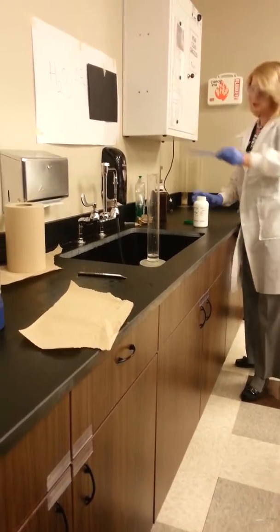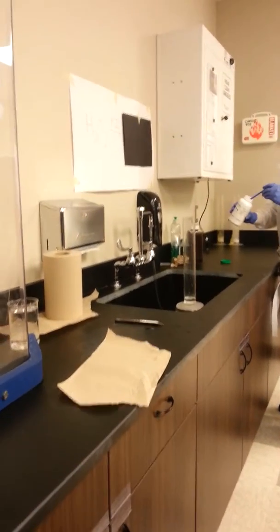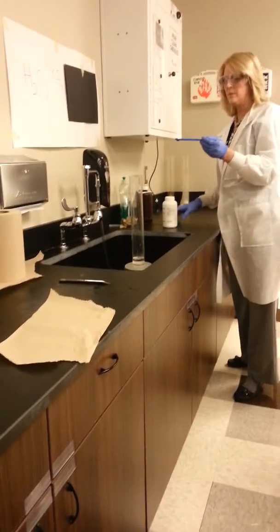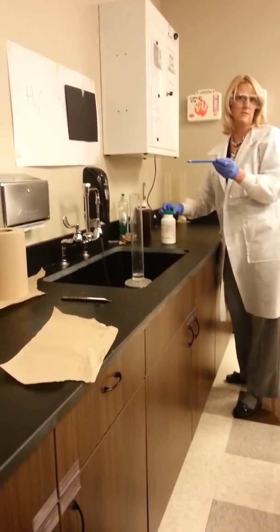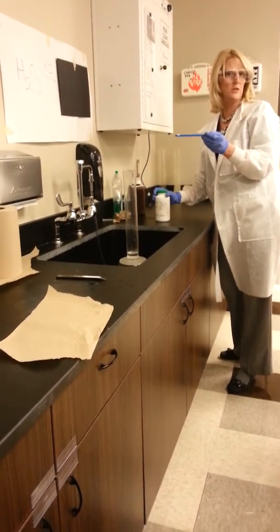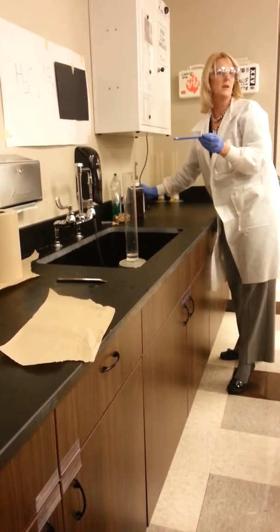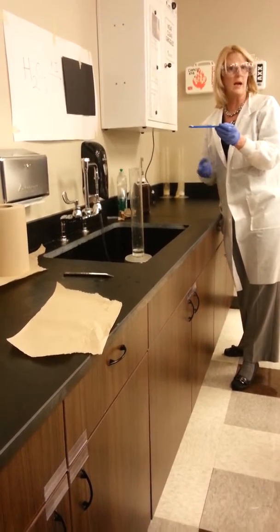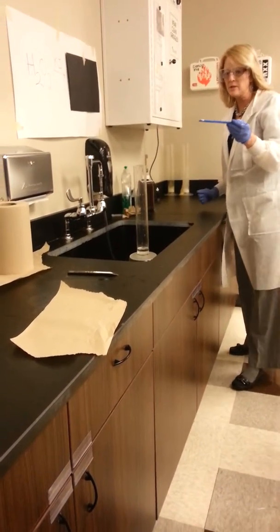If you look at my reaction up here, is potassium iodide a reactant? No, it's a catalyst. So should it be used up in this reaction? No. In fact, iodine, when it gets wet, is yellowish in color. So you'll probably see a yellow residue, letting us know it wasn't really used up in the reaction. It is left over from the reaction.